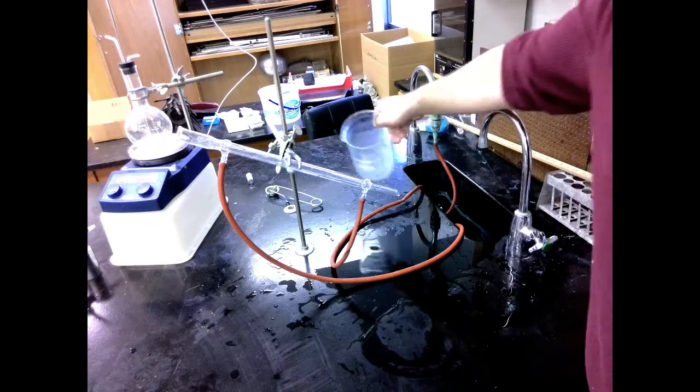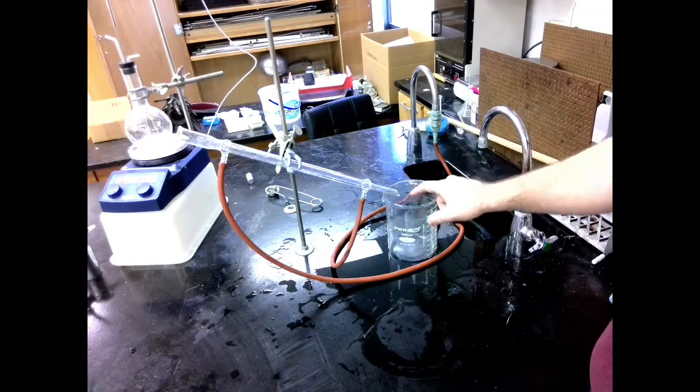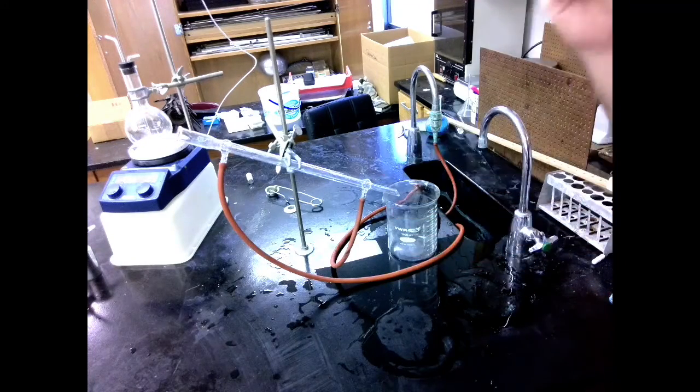I'm not going to turn it back on now. But once this is set up, my thousand milliliter beaker will sit right under this nozzle and it will drip right into here. Next, let's go ahead and look at how we put these three parts together.